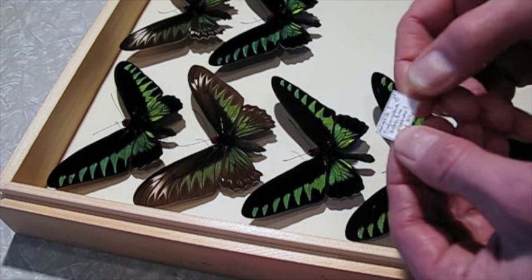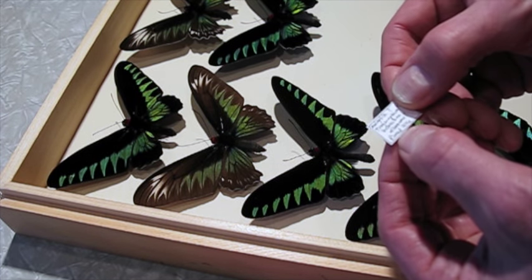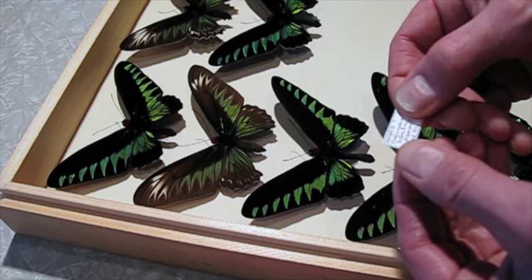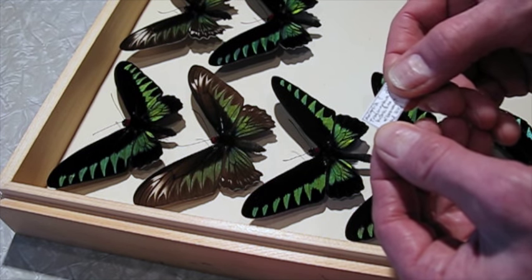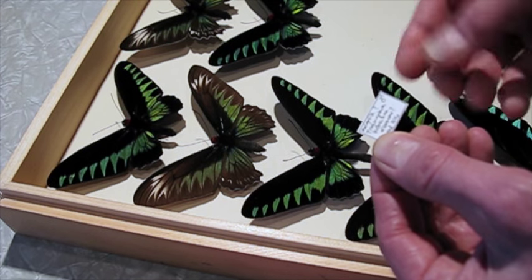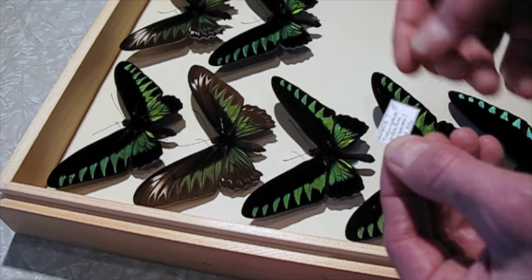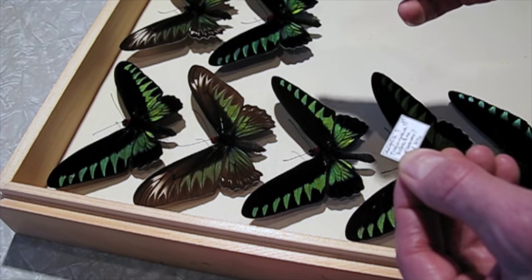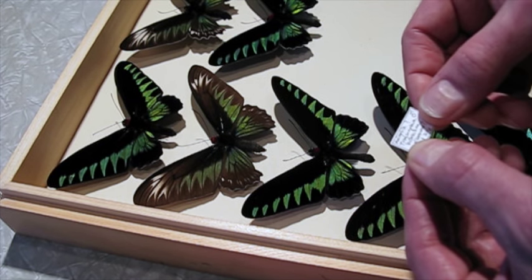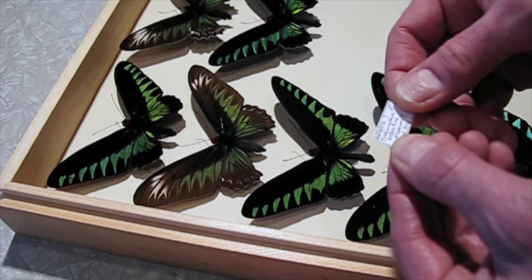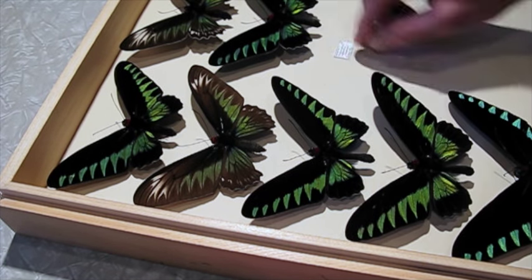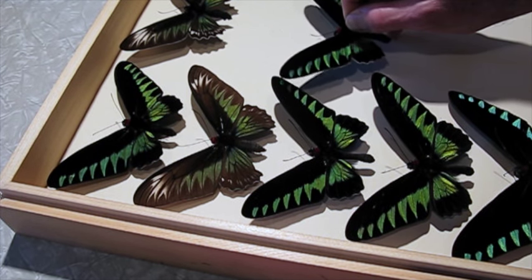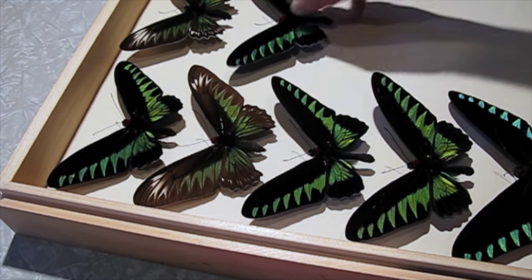Now it's still important to label them even if we don't have data, because you always try to do the best you can labeling things so it's as useful as it can be. So I use these acid-free paper labels and a very fine tip pen. I'm going to write the location as the Albescens location, Malaysia, but with a question mark. It just shows that I'm not really sure, that's my guess but I'm not really sure. I think it's okay to put information on a data label that you suspect, again if you use a question mark so it indicates you're not sure.